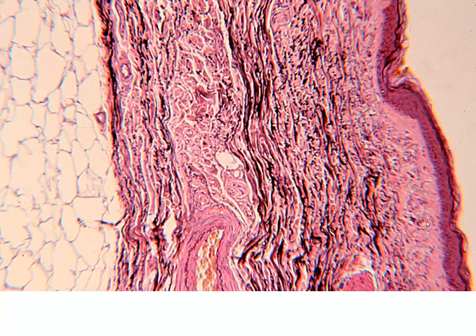So you can see the elastic nature of this layer in our dense irregular connective tissue. And you can even see some of the elastic lamina around this blood vessel. So this is not just collagen. We have a high density of collagen there, but we also have elastic fibers as part of that.